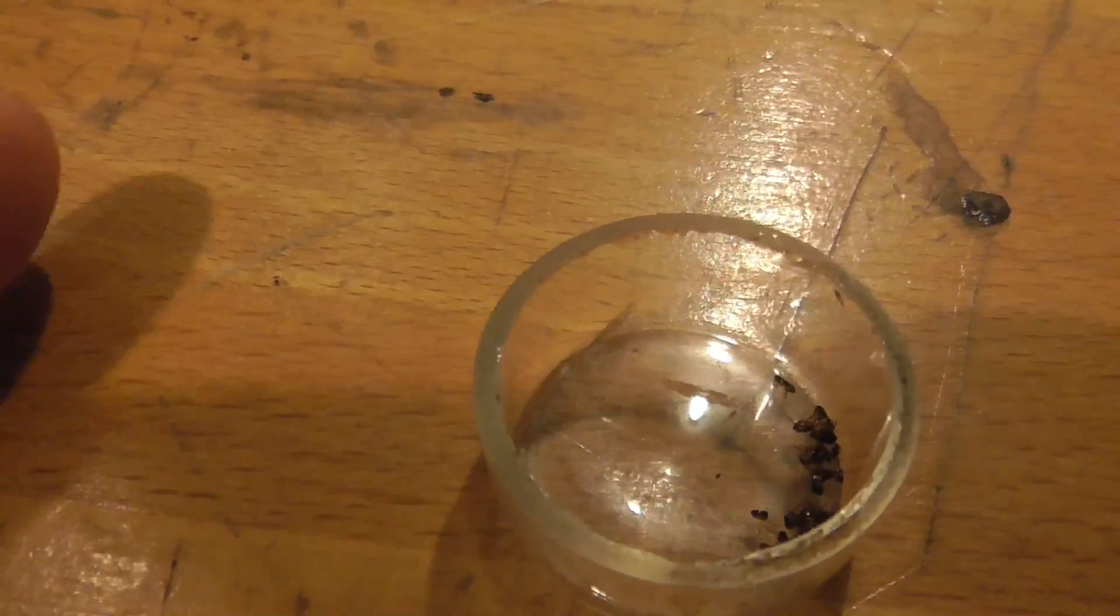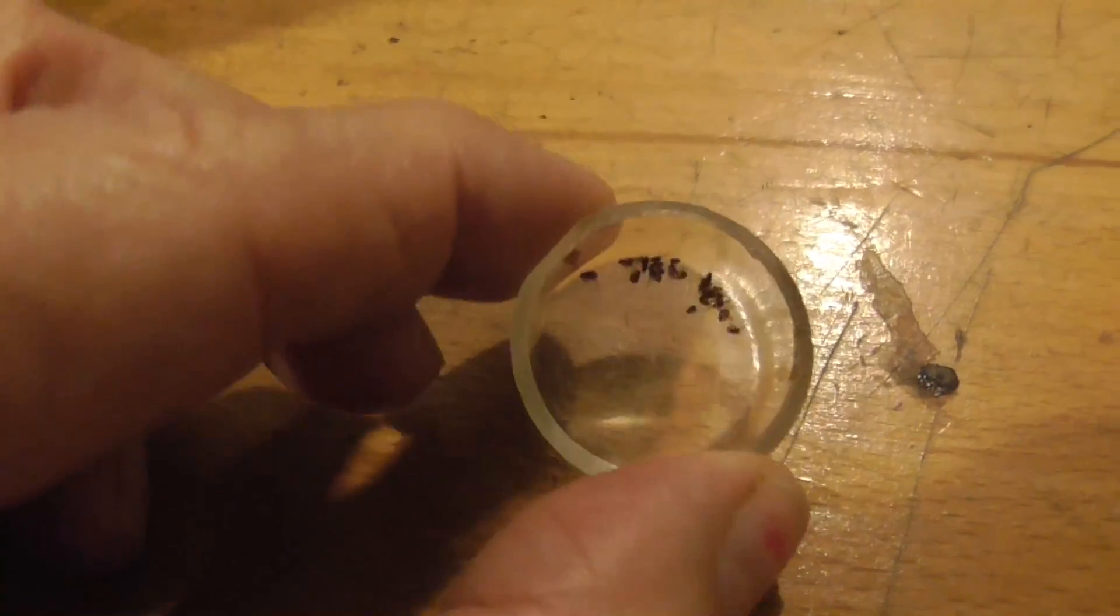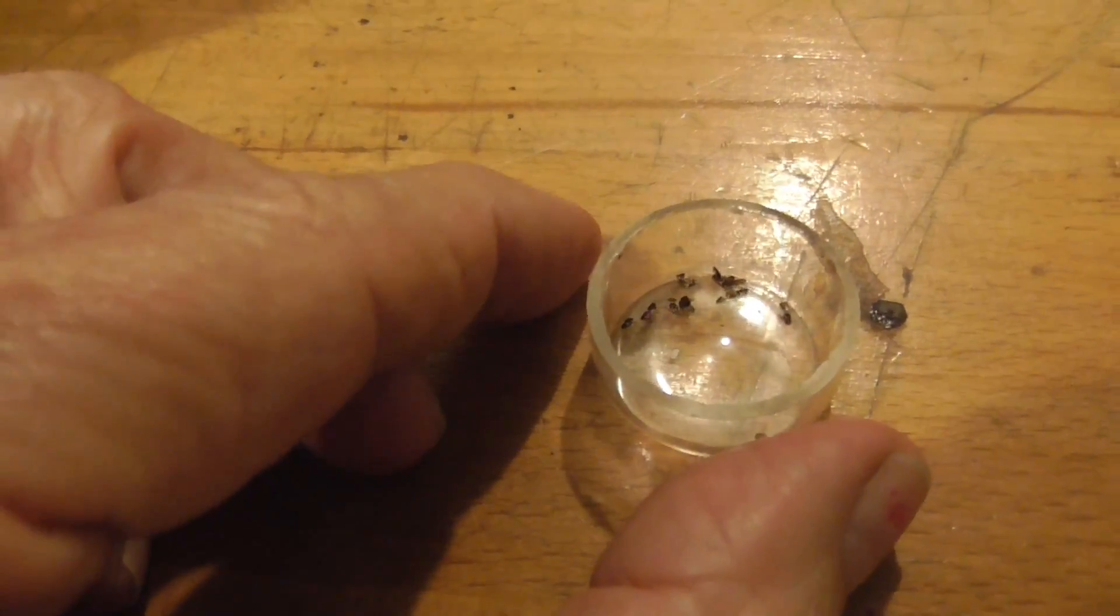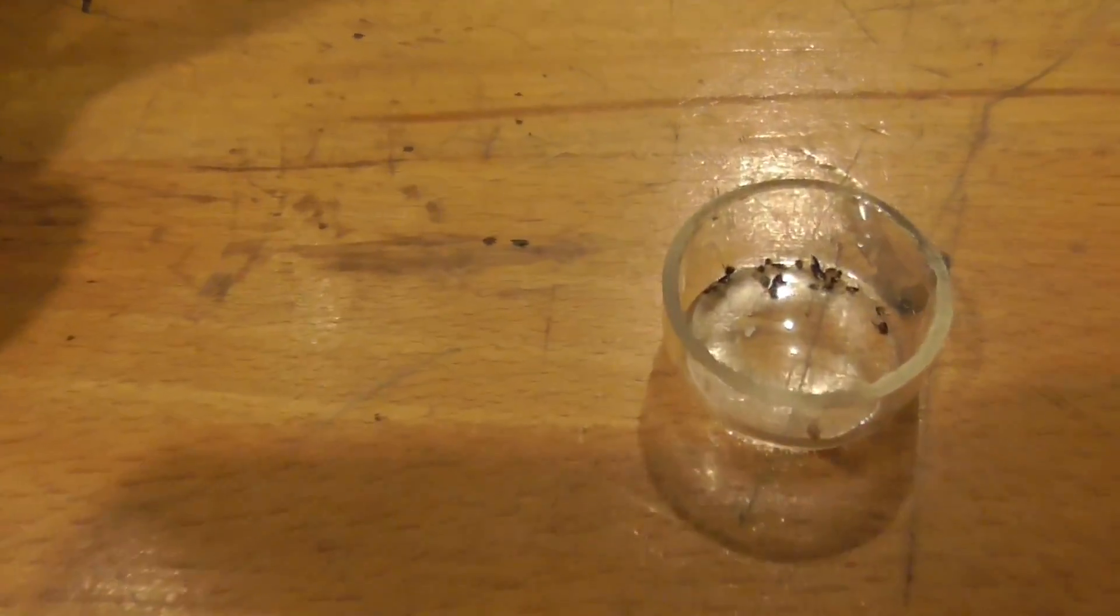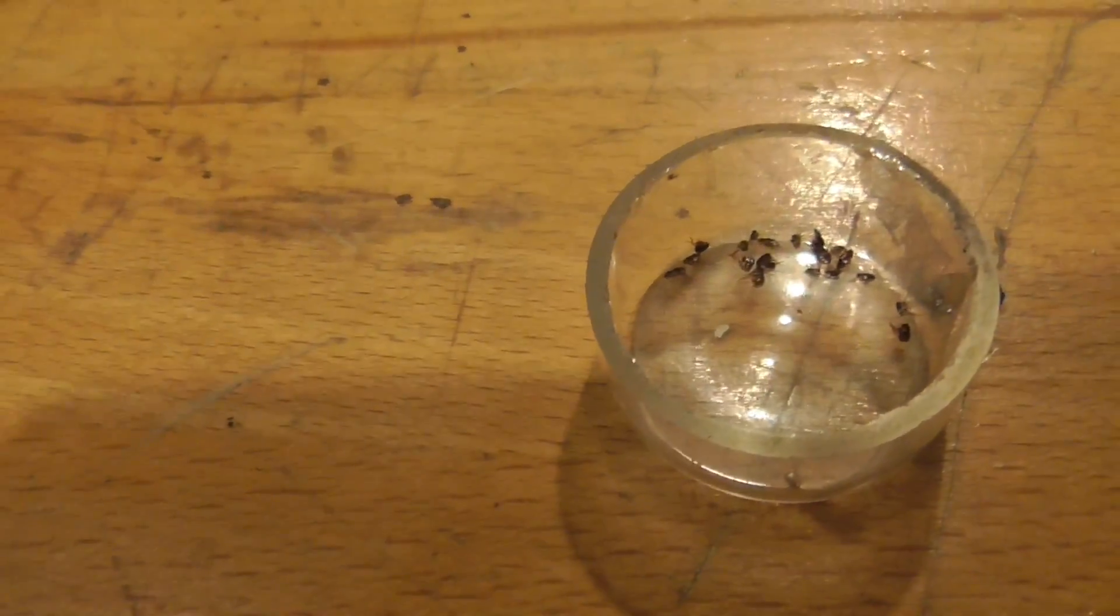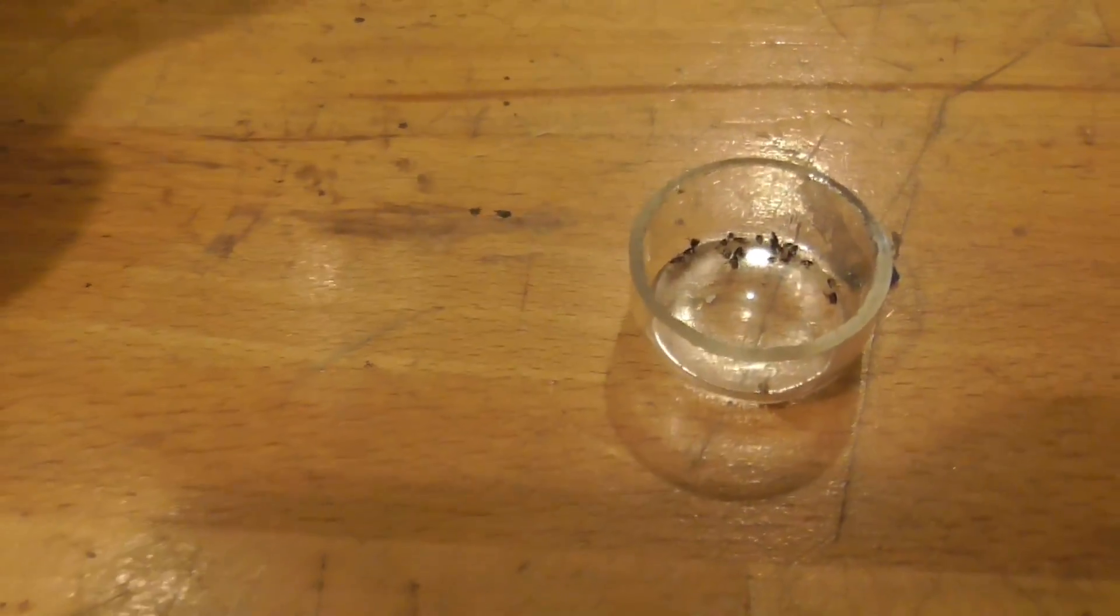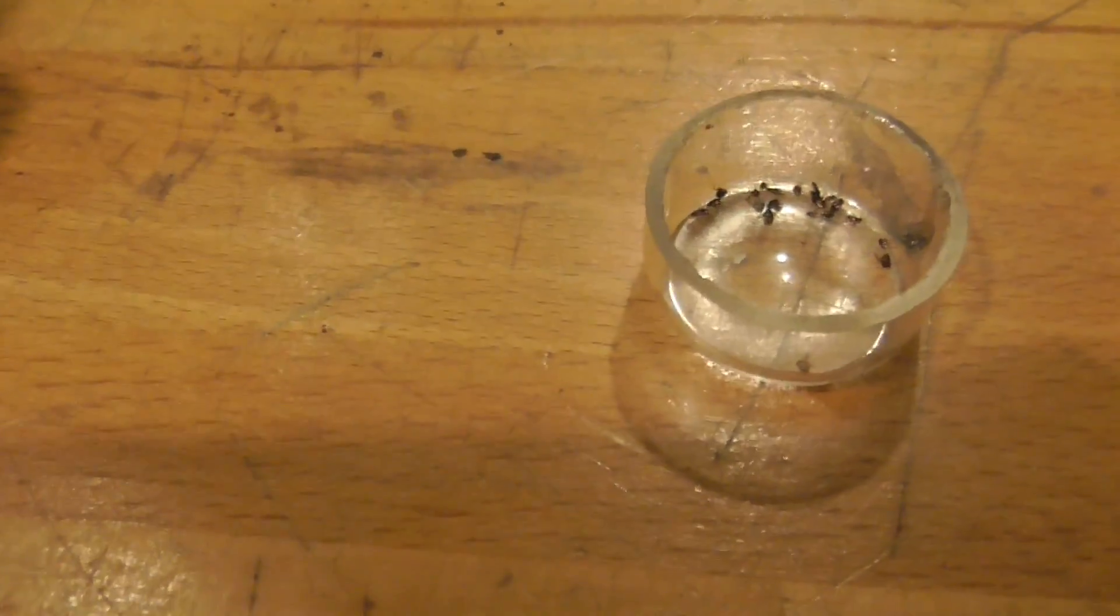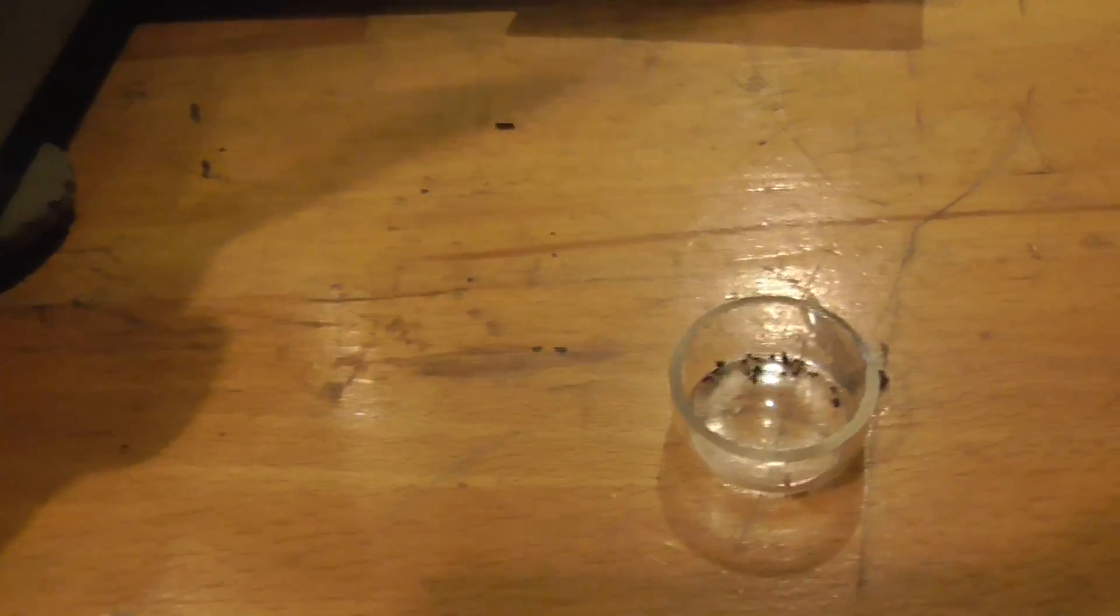Here are the test subjects - that's a bunch of fleas. This was very painstaking for me to get these off of the cat. It took me several days to do it. The cat doesn't have very many fleas on her, so I had to just sit there and each day I'd look at her and see if she had any fleas. And I'd get them off of her and kill them and then put them in this little cup here so I could save them. Because we can't weigh one flea. One flea is going to be less than 100 micrograms. But we hopefully will be able to measure the number of fleas that I have in here. I haven't counted them yet. There's probably around 20 of them in there.